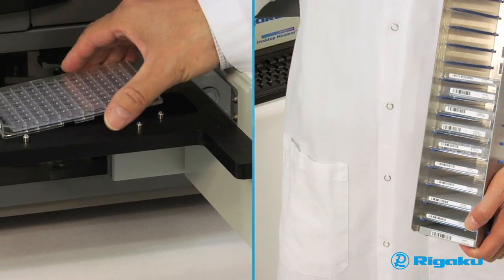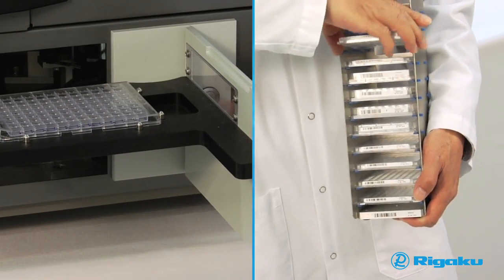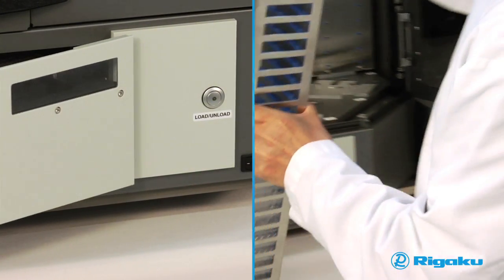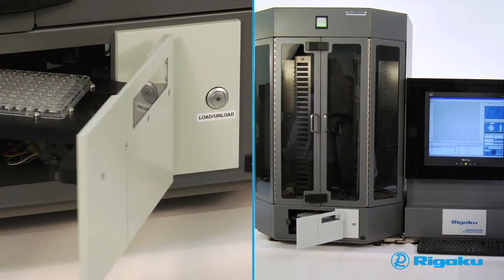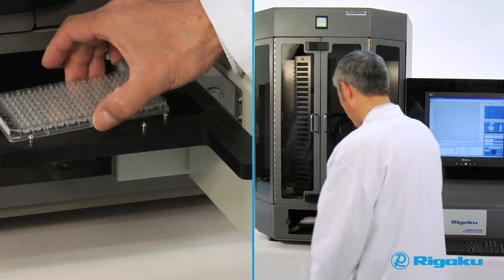Plates can be loaded based upon your volume needs by placing a single plate or an entire cassette into the Gallery DT, and easily retrieved from the Gallery DT for harvesting.